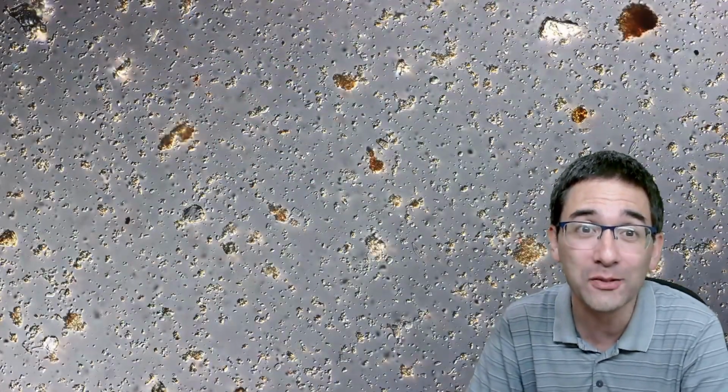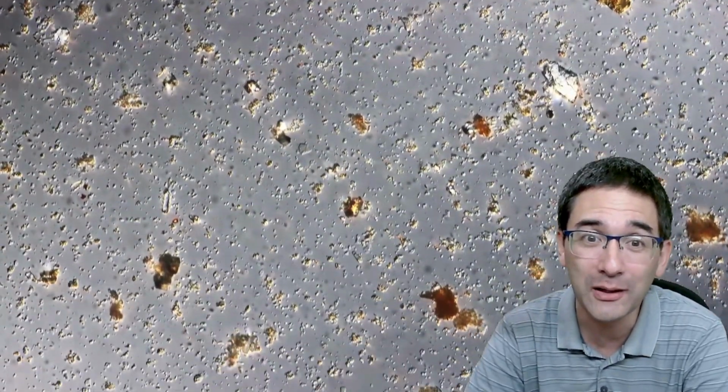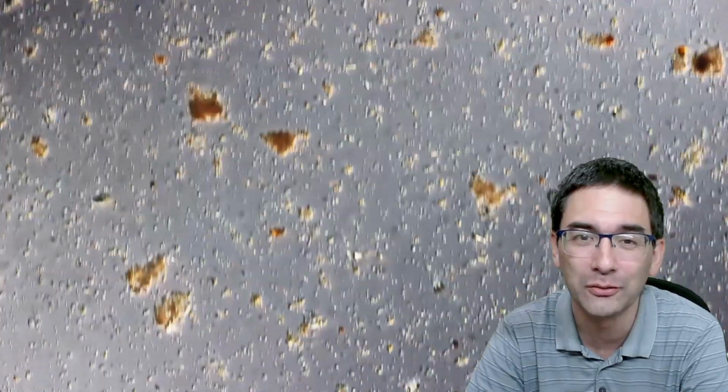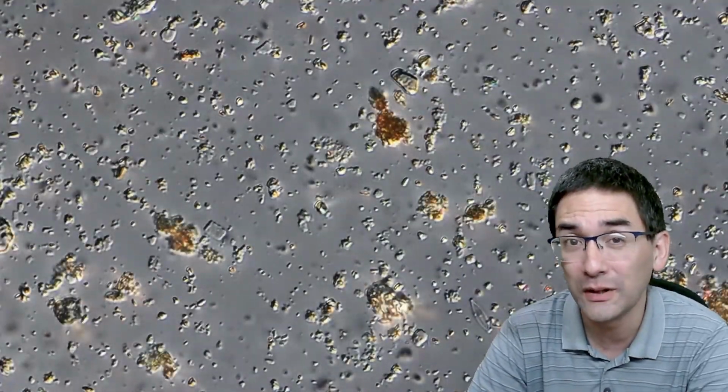Well, what did I find? That's of course the main question. I put some of this sediment under the microscope, and this is what I found. Just one living thing here. Look, a little small cell moving around. Otherwise, I did not see a lot. And I think I already know also why.